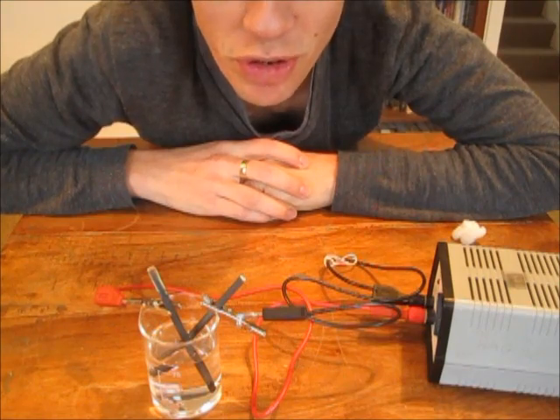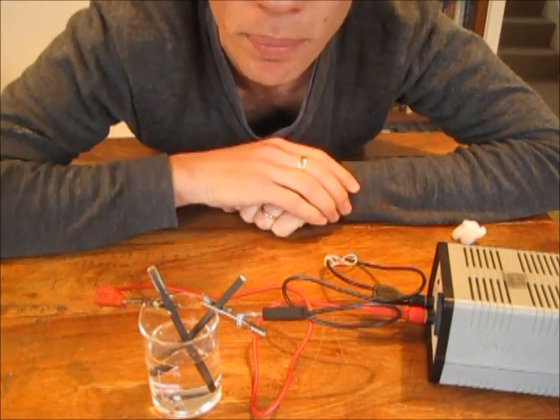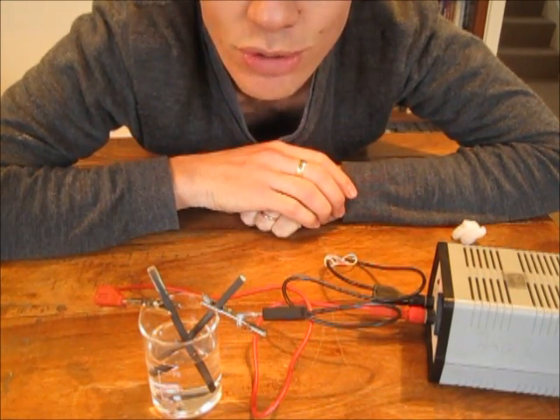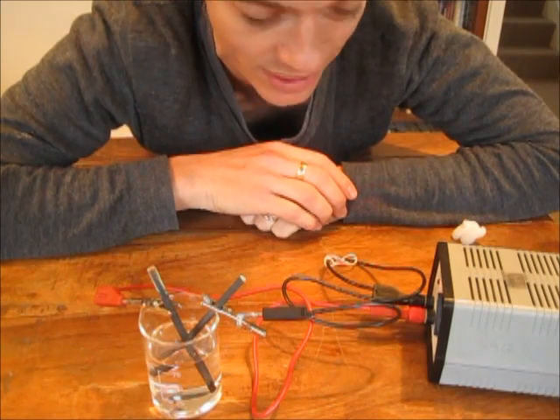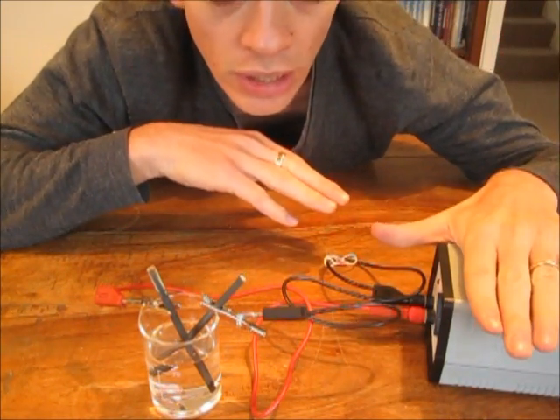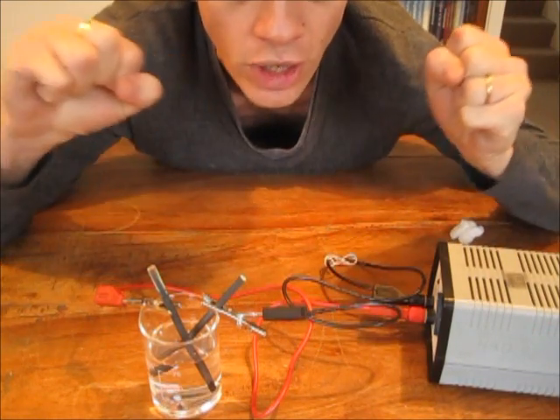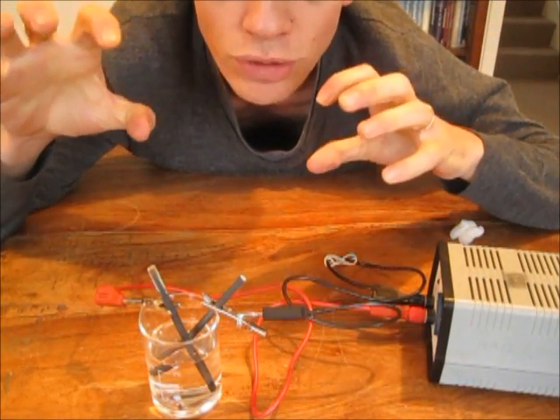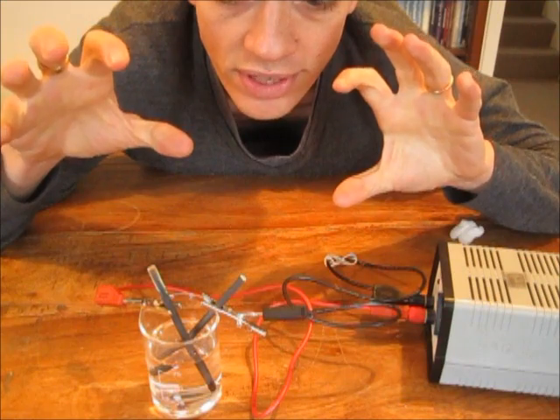This is all about electrolysis and here I have my equipment for electrolysis. What is electrolysis? Electrolysis is using electricity to break up a compound into two different substances.